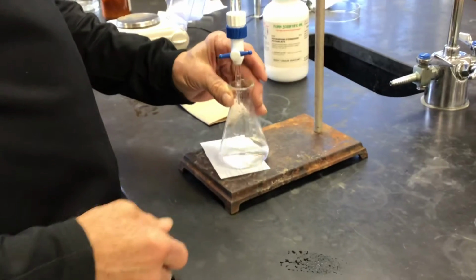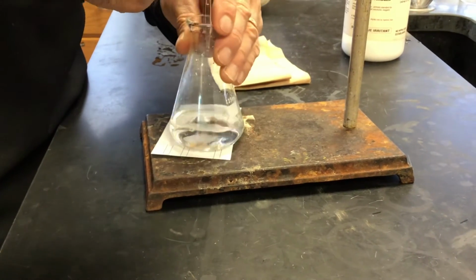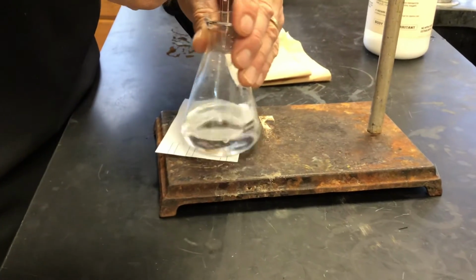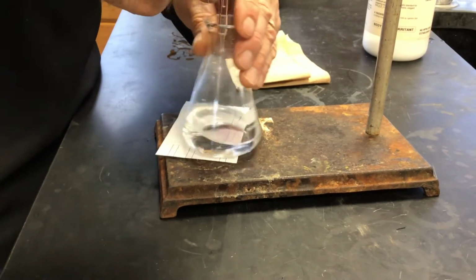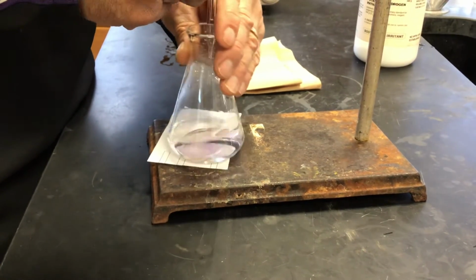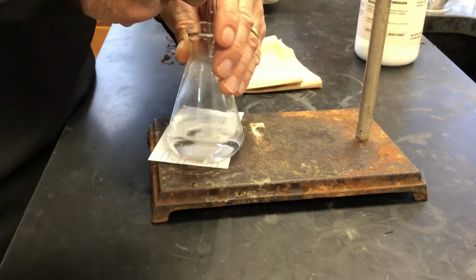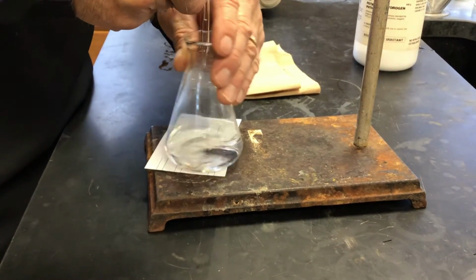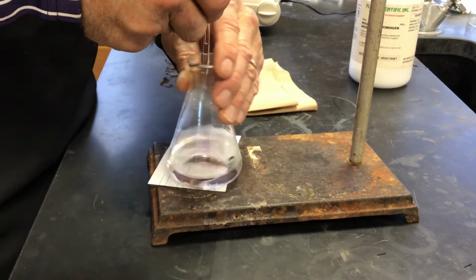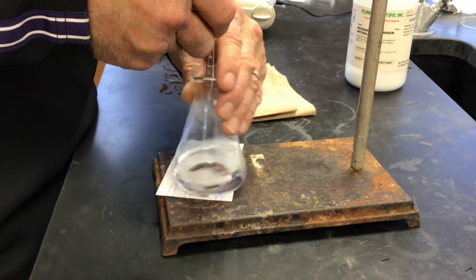Okay. Please disappear. All right. So now let's see if we can hone in on it a little bit. Oh, getting close.